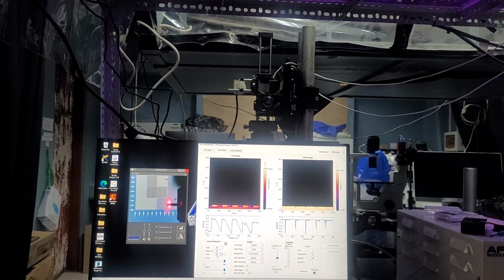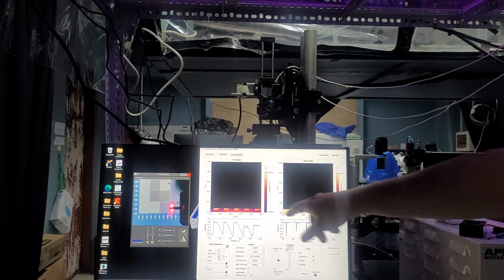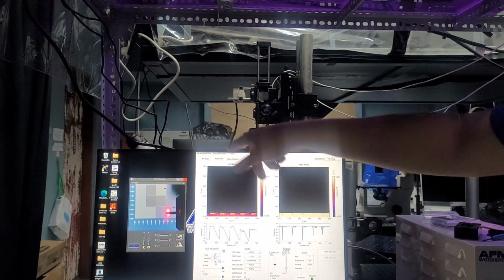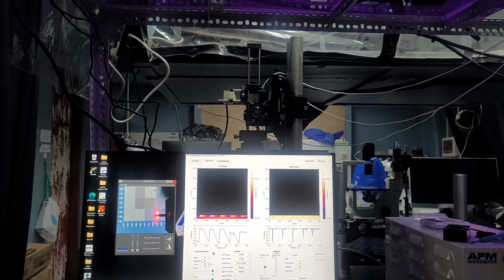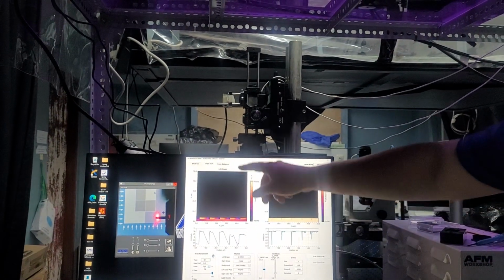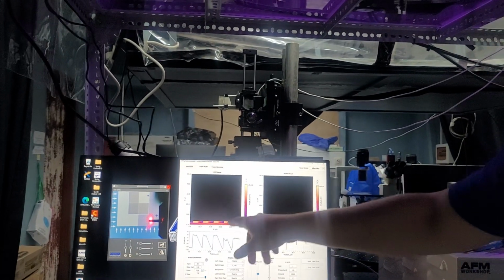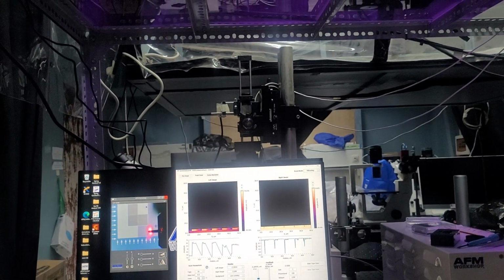Below that is lines. This will control the pixel density of your image. So it's essentially how many times that cantilever will go back and forth across the sample surface. The default for this is 256. That is 256 lines and 256 average data points per line. So it creates a 256 by 256 pixel image.